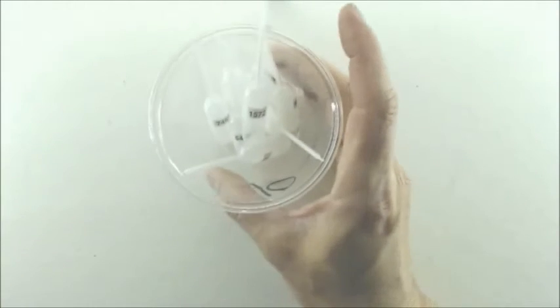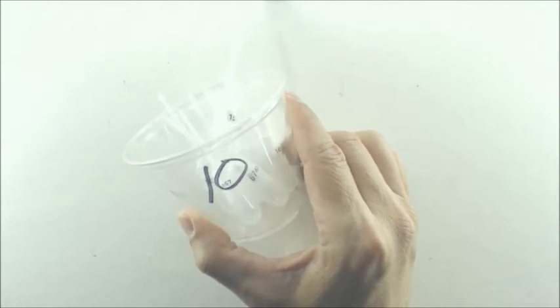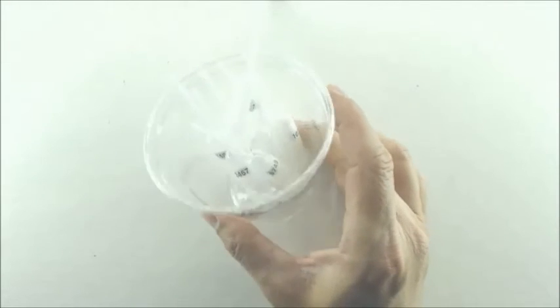Let me go ahead and tell you about the unknowns part of this. You're going to get a cup of unknowns, and in that cup of unknowns there are 8 pipettes. So this is cup number 10, for example. It doesn't have any solutions in it right now. You'll have your lab report, and on the back of your lab report, let's find a version that's similar to yours.